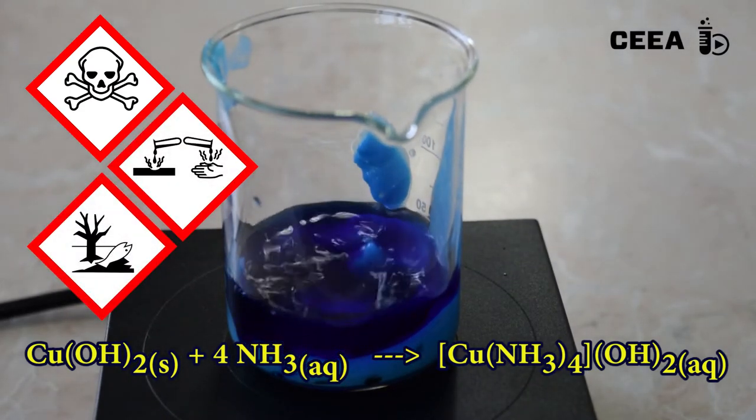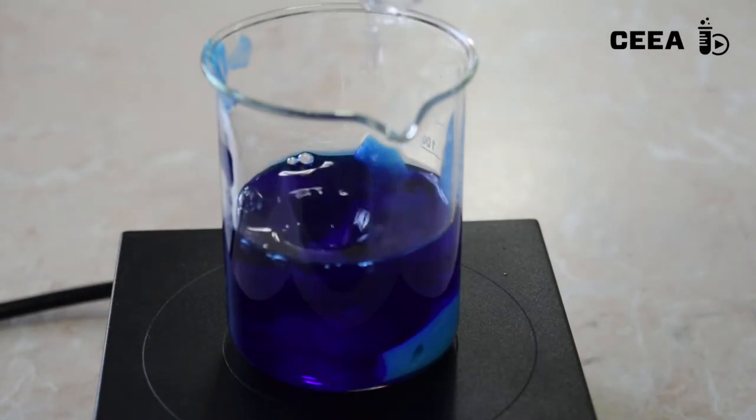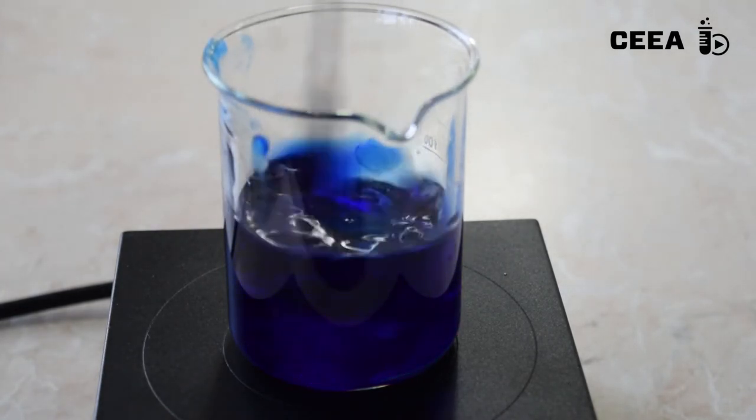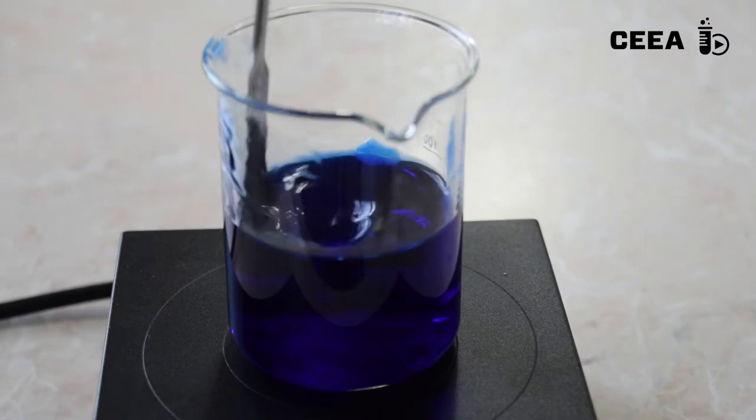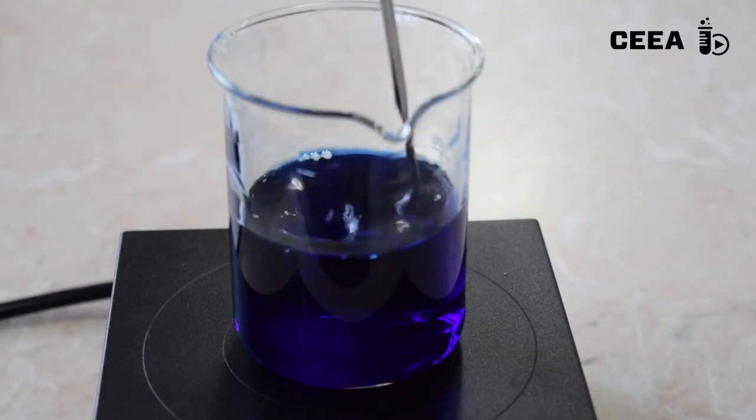Do not breathe the ammonia vapors as they are toxic and caustic. Notice the deep blue clear solution known also as Schweizer's reagent.